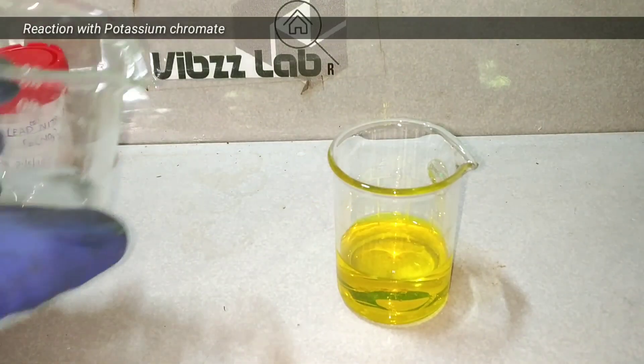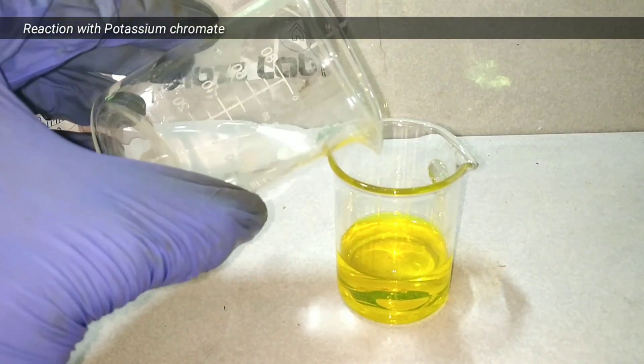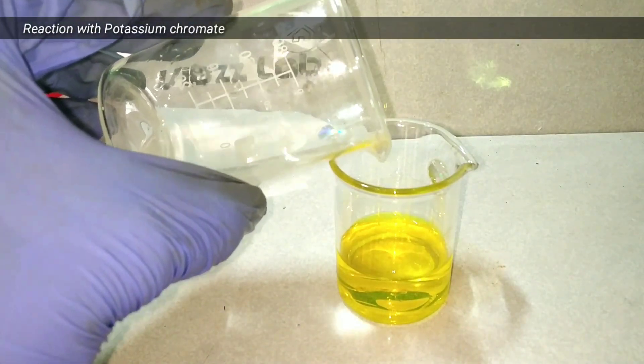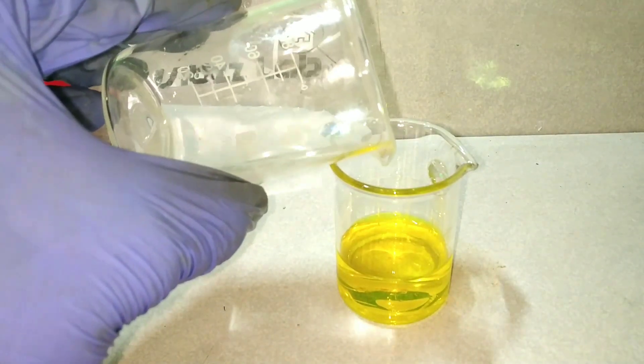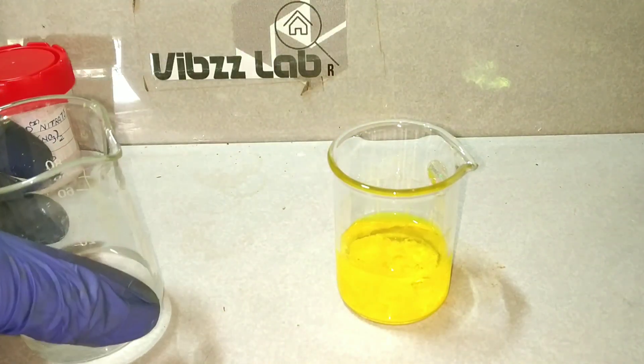Lead(II) nitrate also reacts with potassium chromate solution, giving a yellow precipitate of lead(II) chromate.